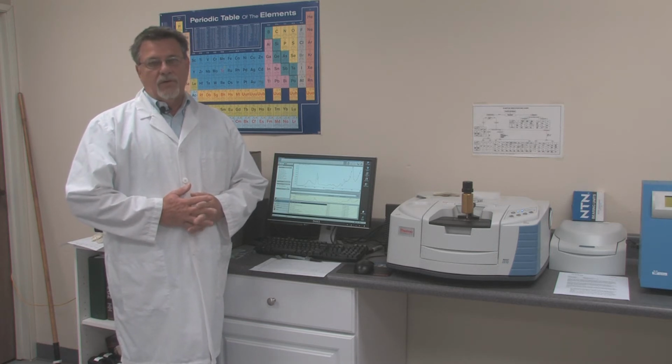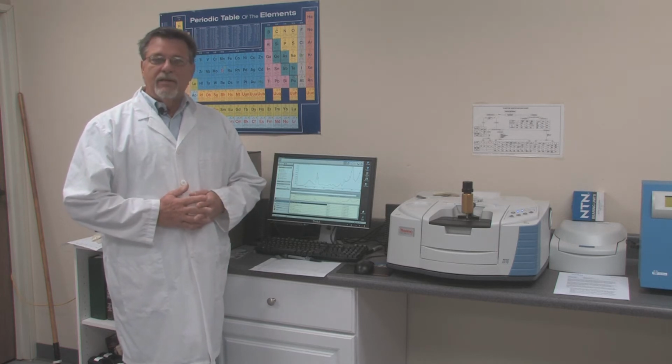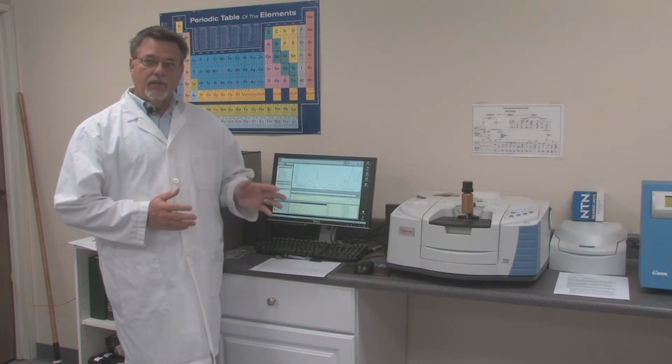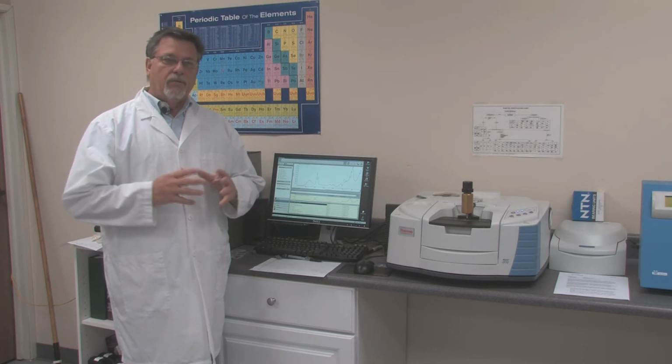You'd be surprised how many times we find that even our customers are getting materials that are not quite to spec. So this machine here has over 19,000 different polymers and elastomers listed on it. It gives us the ability to take a look at the infrared footprint of a material, and identify exactly what it is, or bring it into a very, very close spectrum of what it might be.